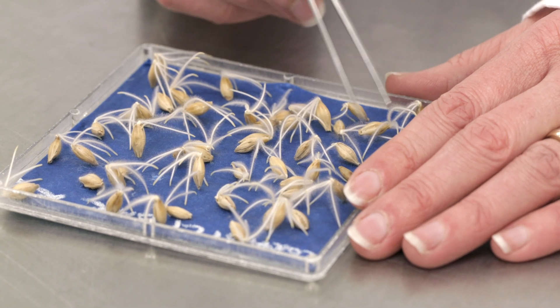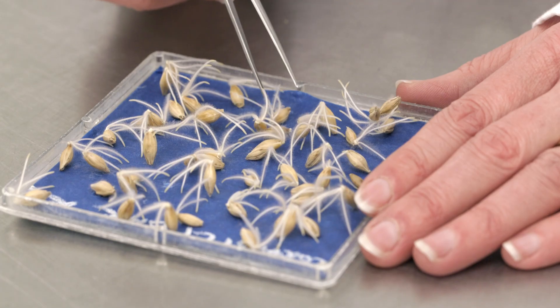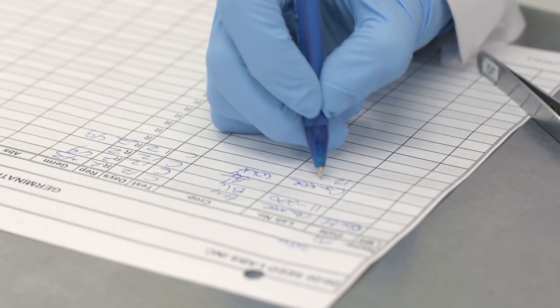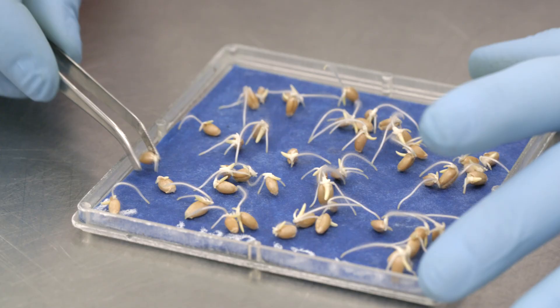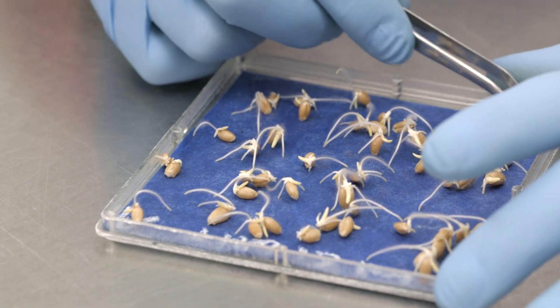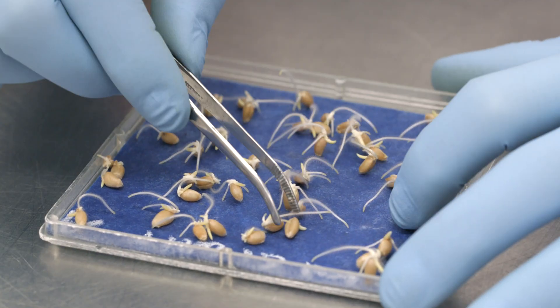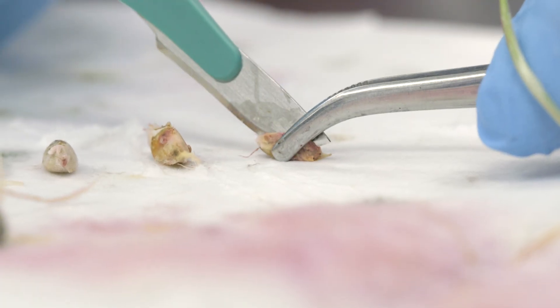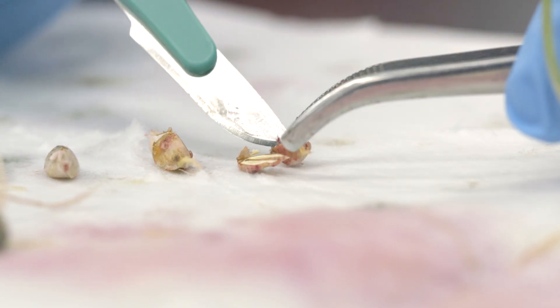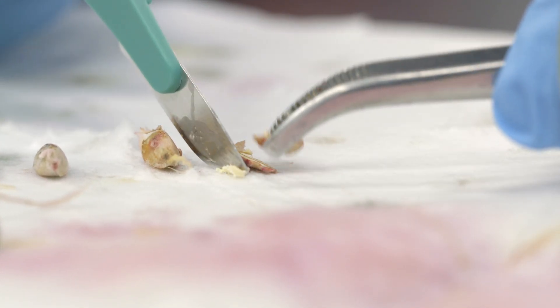The percentage of normal seedlings that are capable of developing into healthy seedlings are counted. Abnormal seedlings that have one or more essential structures that are either damaged or absent are also noted. Finally, dead or fresh seeds that have no external symptoms of life are cut in half with a scalpel to see if they are viable.